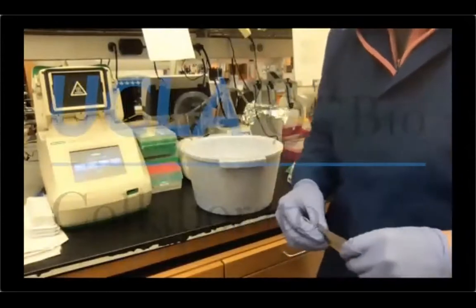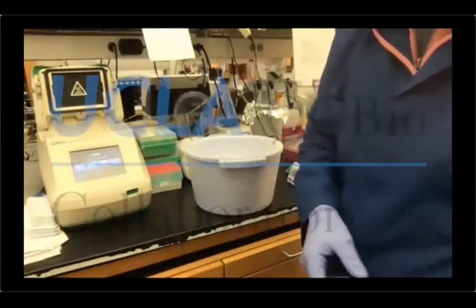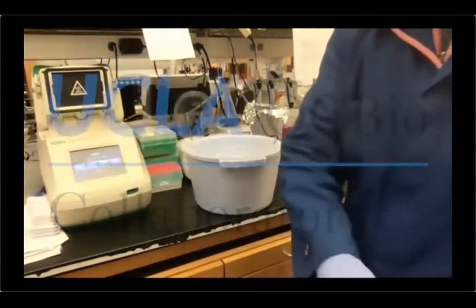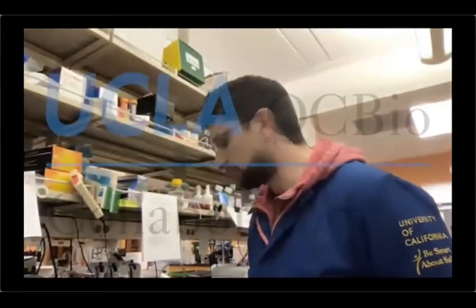Agilent suggests you use the screen tapes within 2 weeks of the first use. However, in our hands, especially for the regular sensitivity applications, even going after 2 weeks, usually they work just fine. For high sensitivity, you might have some problems, meaning that the information it is giving you is correct, but you might miss some lanes. So why don't we just go to the TapeStation, and we're going to load our samples and start the run.